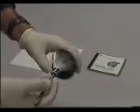Many people simply dip their brush directly into the jar of powder. You should be careful not to damage your brush if you work this way. You can also pour the powder out onto a nearby surface to work from, or make a paper dish to hold your powder.